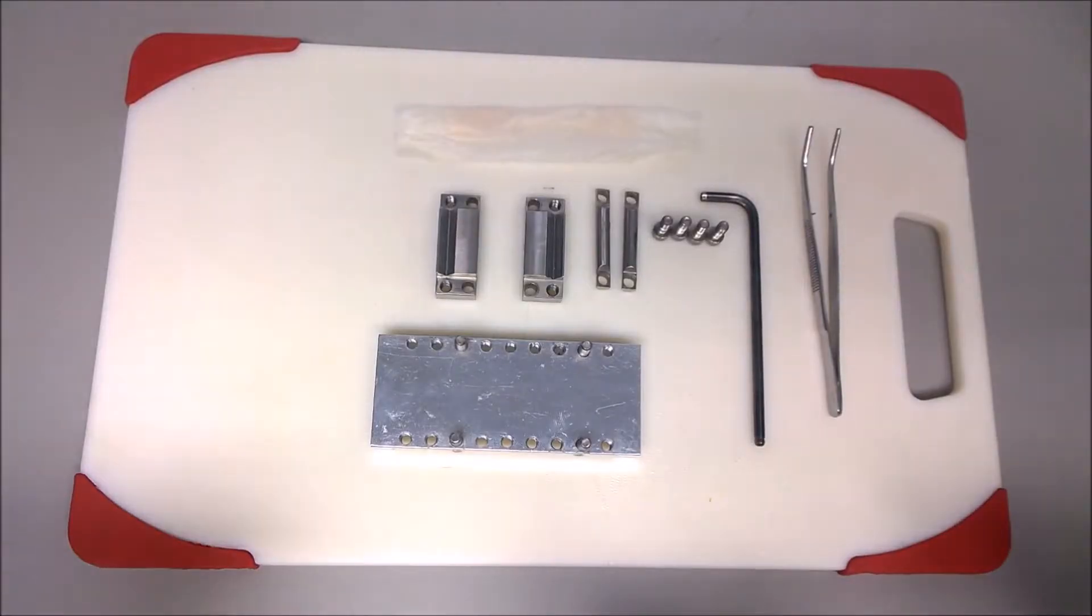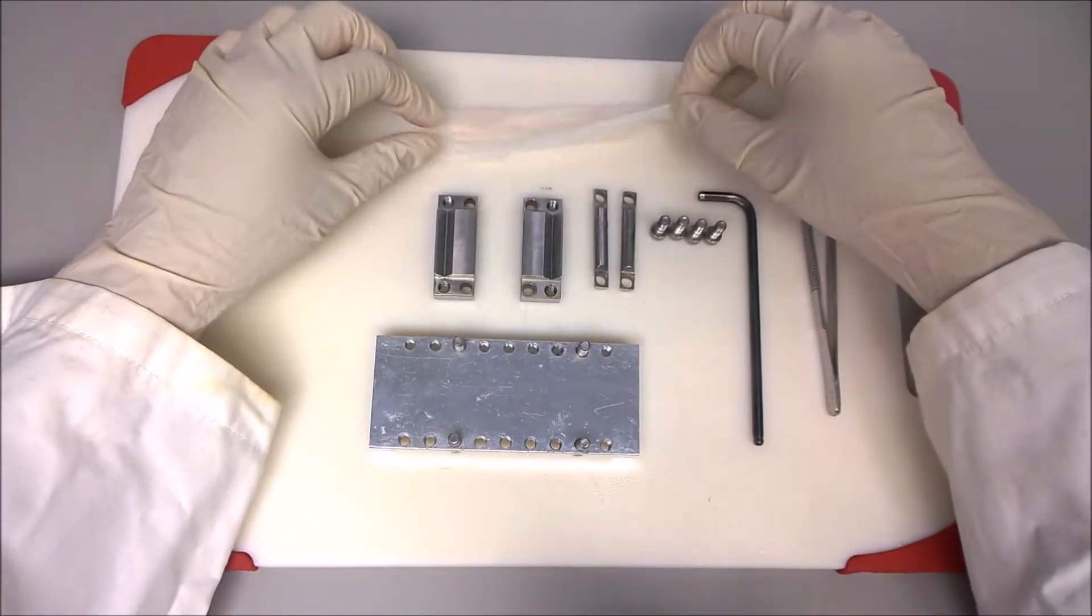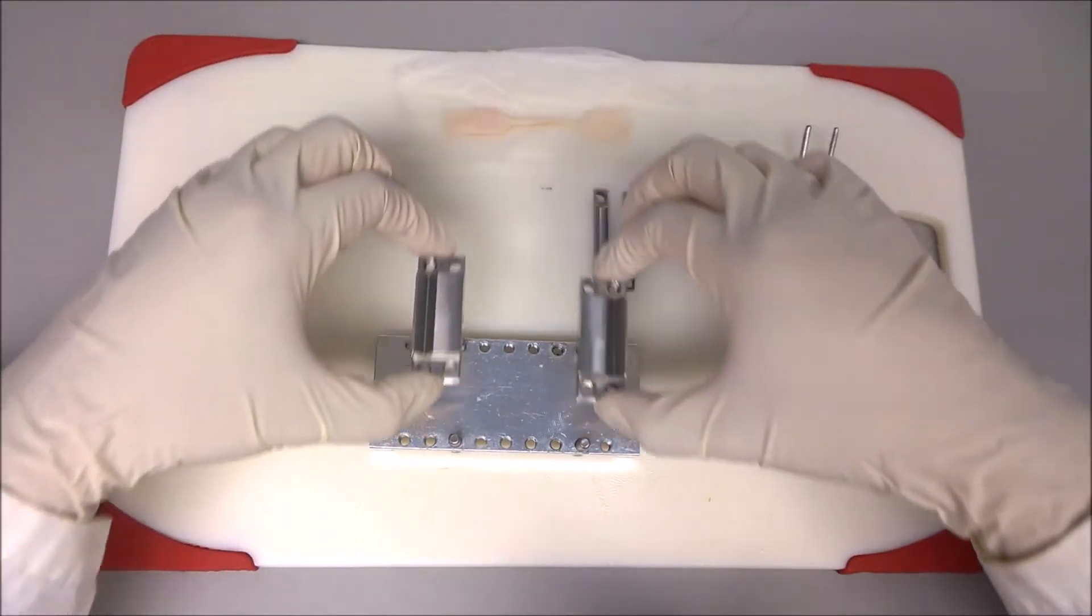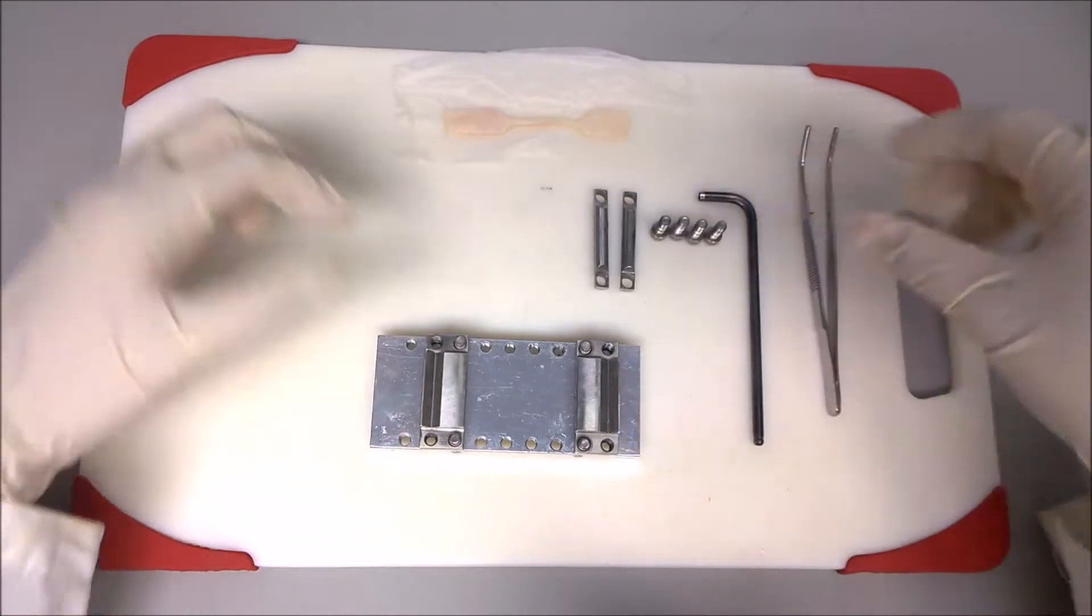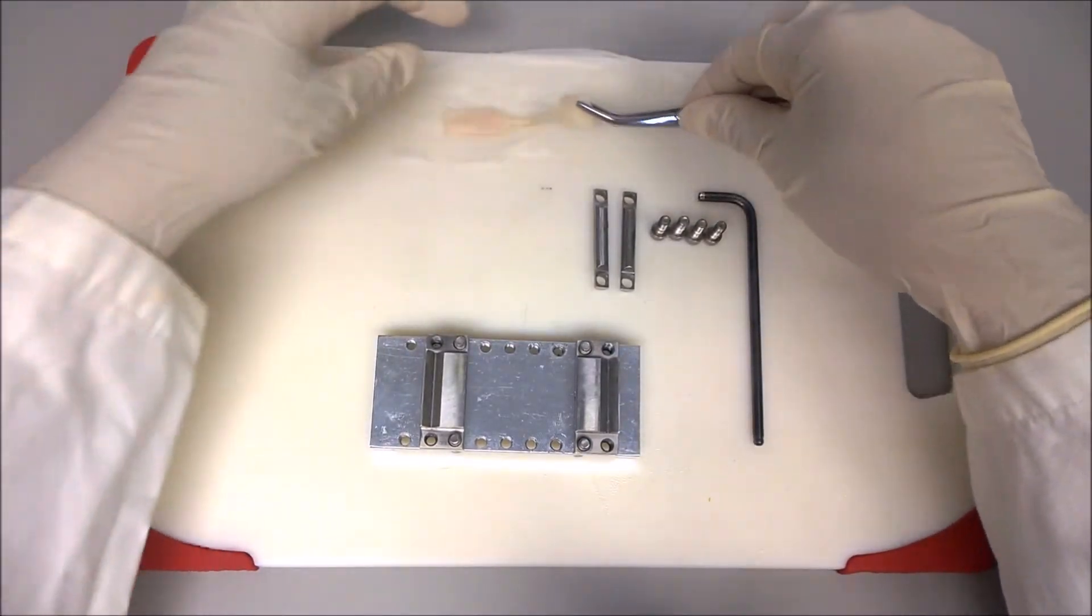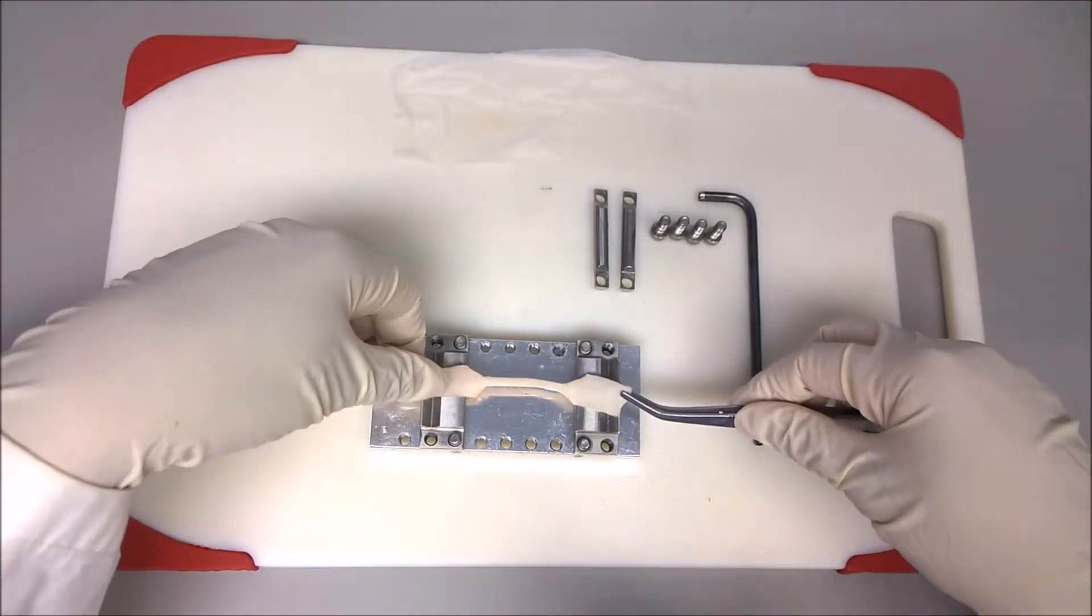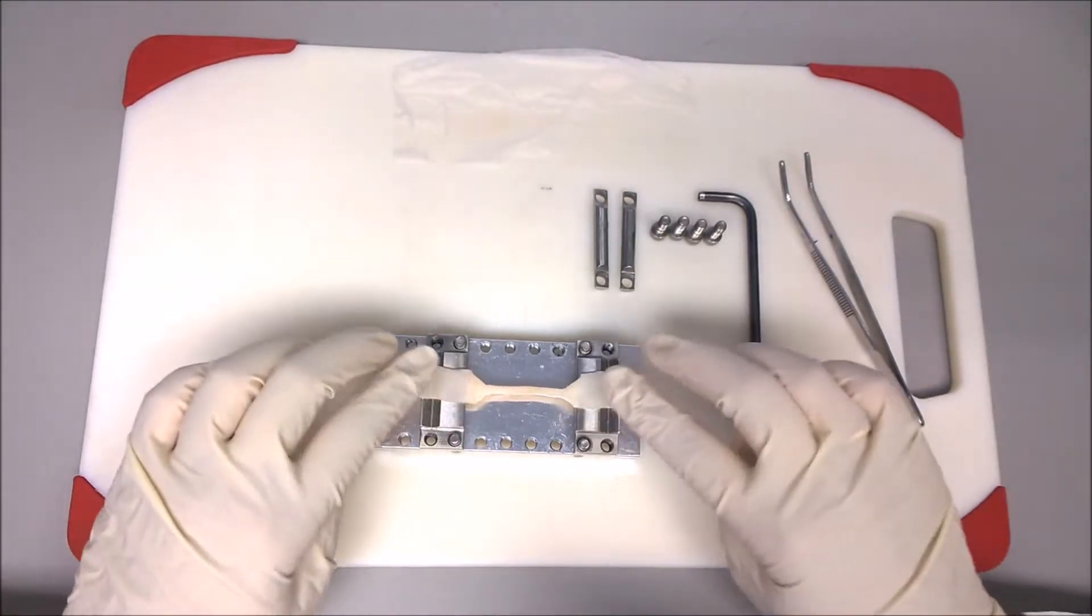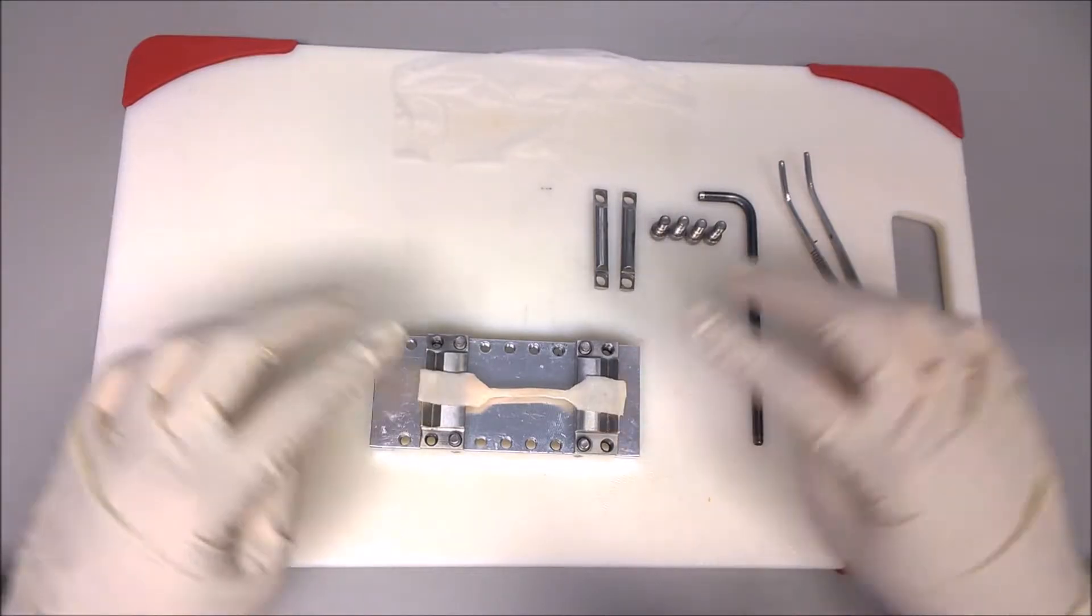Wear complete protective laboratory gear when manipulating biological samples. Position the two tensile grips on the assembly plate. Using tweezers, position the skin sample with the hair side up on the two tensile grips and make sure it is centered.